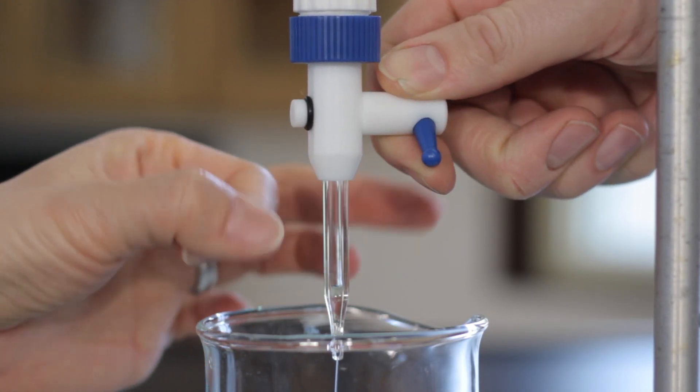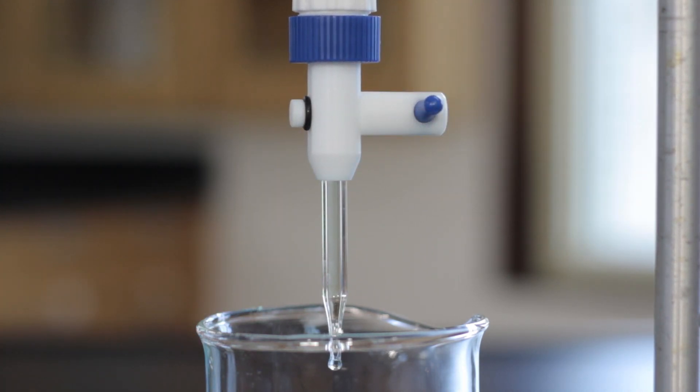Make sure that there are no air bubbles trapped in the tip of the burette by opening the stop-cock fully and flicking the tip.